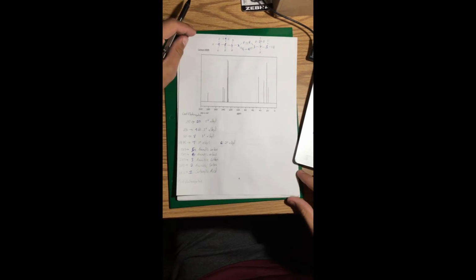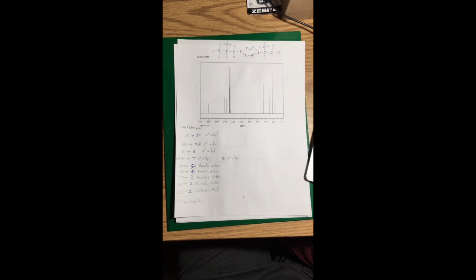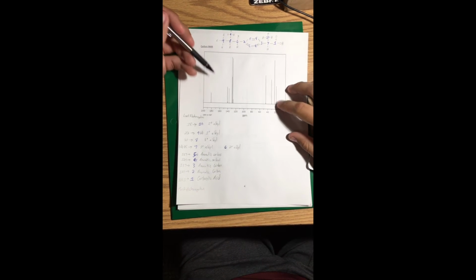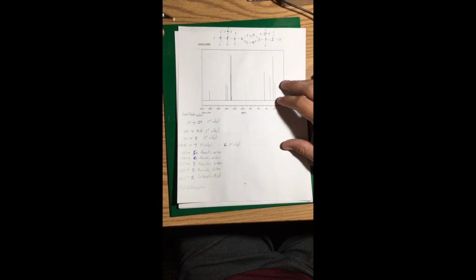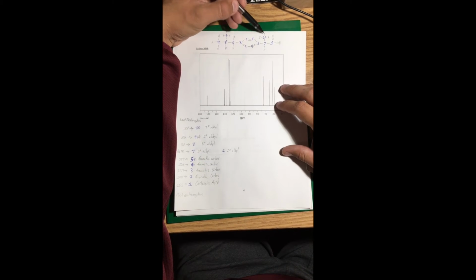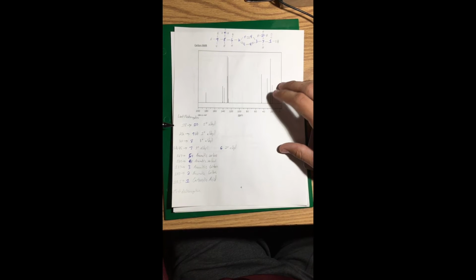So the last step of spectroscopy is looking into the carbon NMR, which will be focusing on the carbon atoms in the molecule. So first off, we're going to start working it right to left. This first line here comes up at 18 parts per million. It's actually a primary alkyl. So I labeled it 10 for you. We look up at the molecule. It's primary alkyl right here. Label it 10.